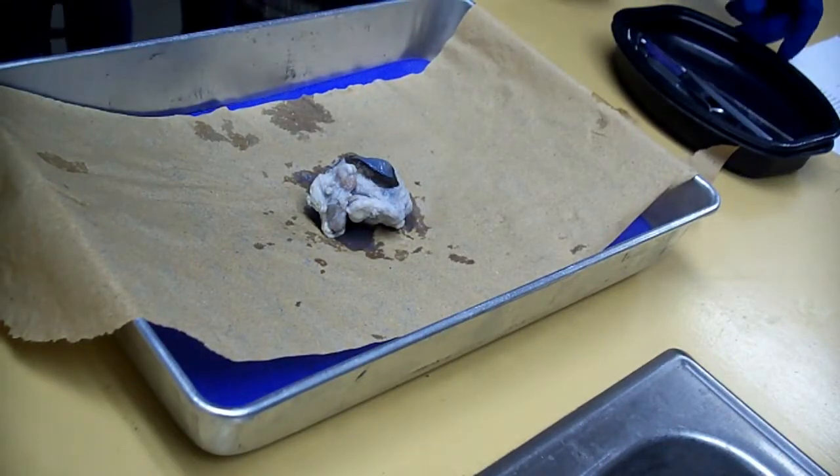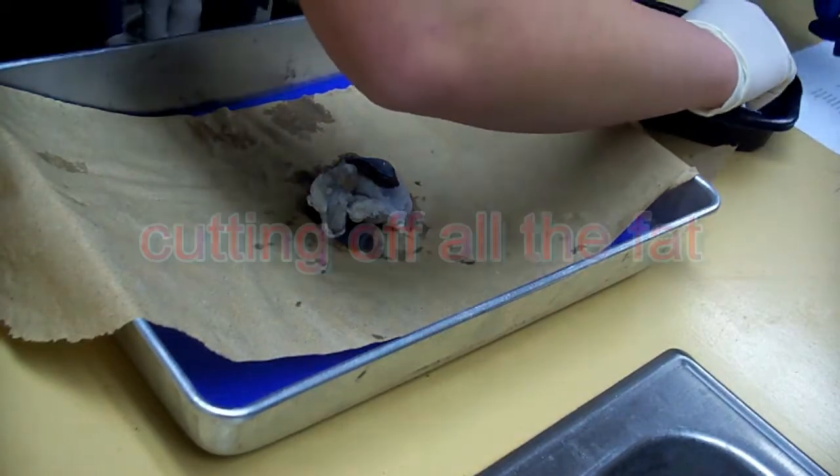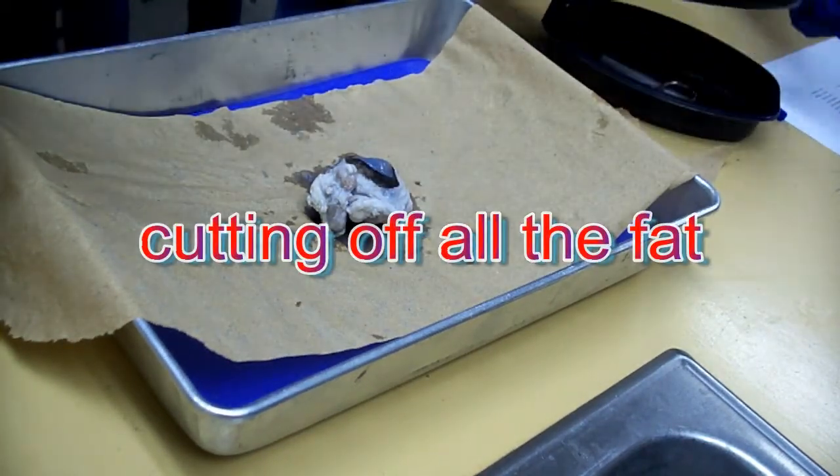They're supposed to be extremely sharp. I know. What the hell is that? No, the scalpels I've always done. Do you want any sharp stuff? No, I've got two.